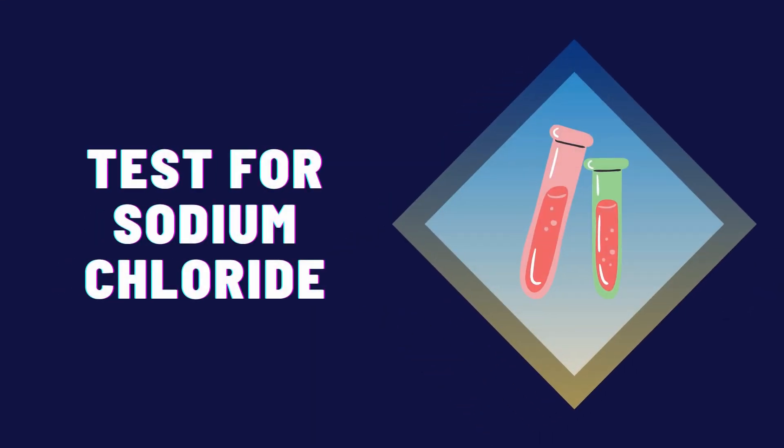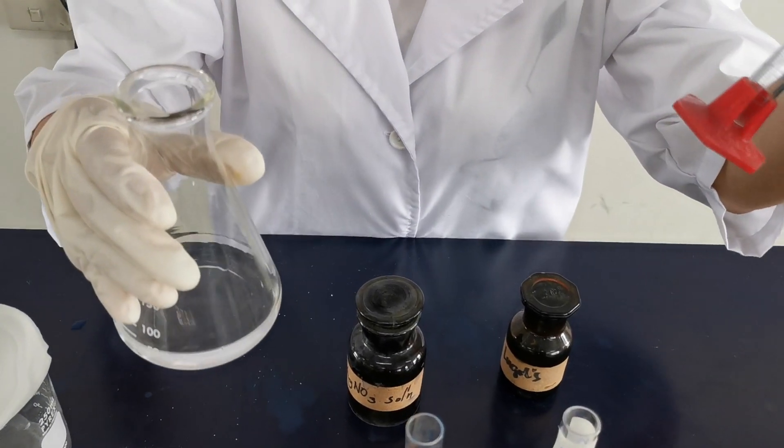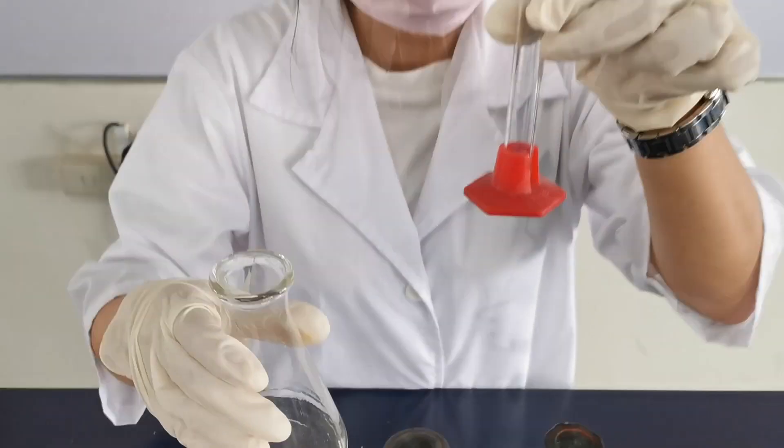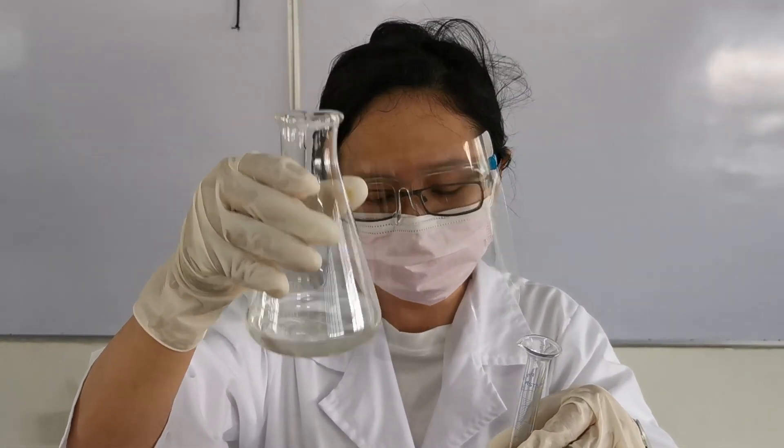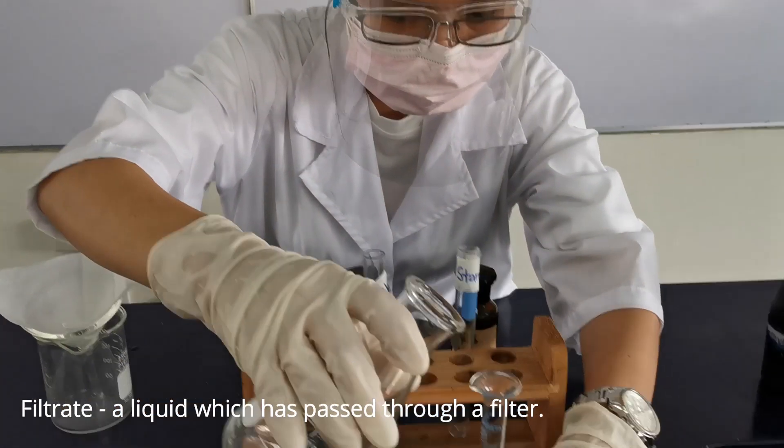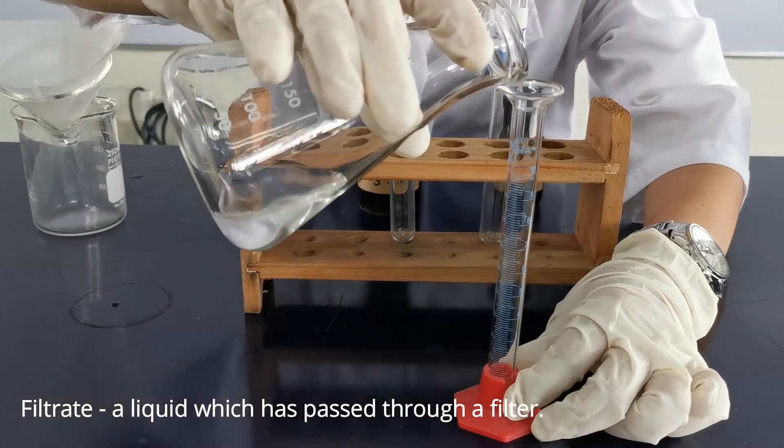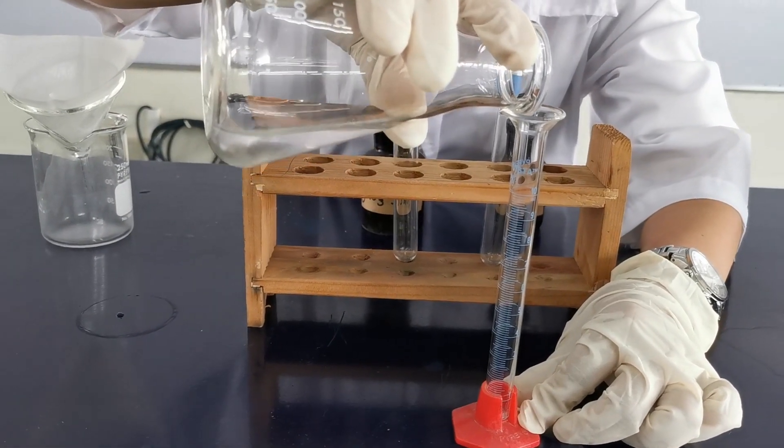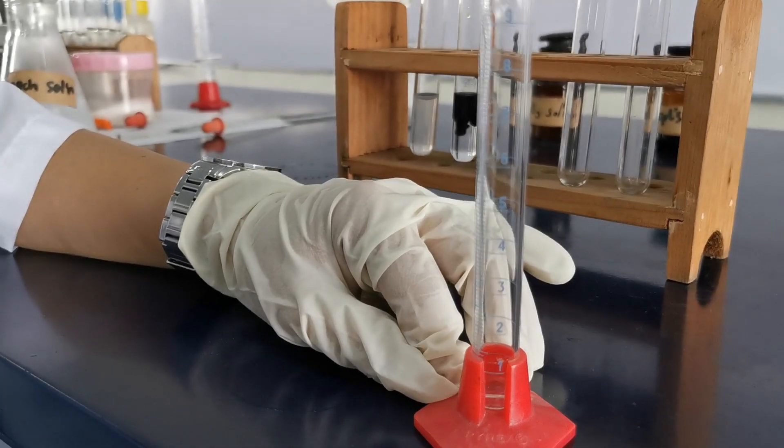Test for sodium chloride. First, we get 5 ml of the filtrate and placed it in a clean test tube.